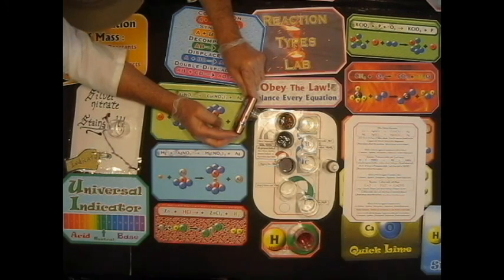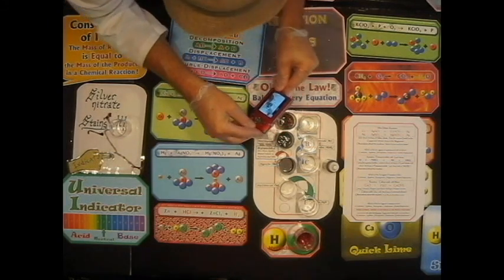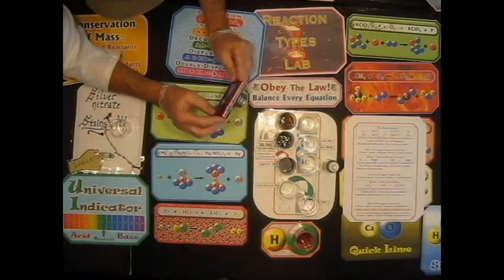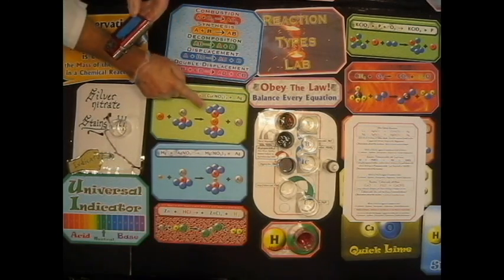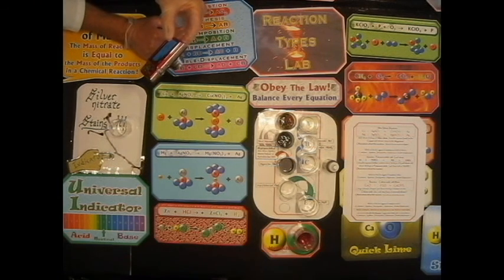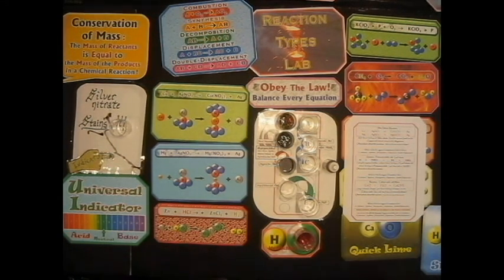So what do you think all that gray stuff could possibly be? All of that goopy, gross gray stuff. What do you think it must be? The silver nitrate. Came out of the silver nitrate. Yeah. So look at these reactions. What gets kicked out of the silver nitrate? What has that gray color? What do you think? Any guesses?